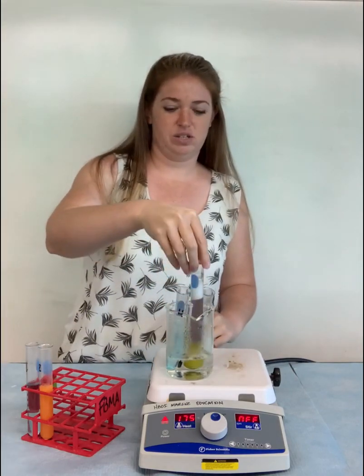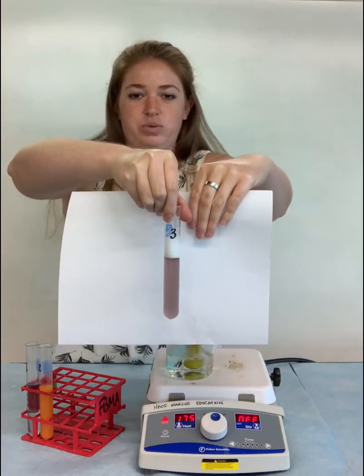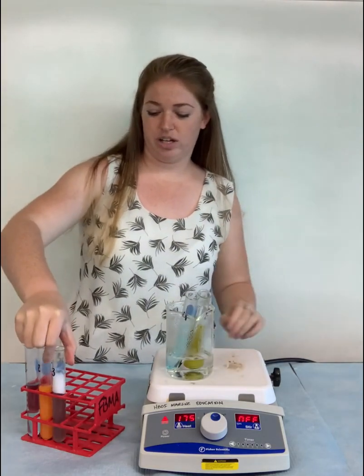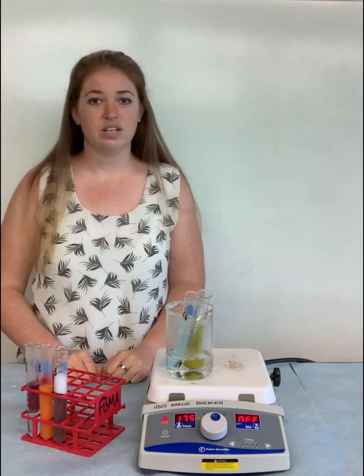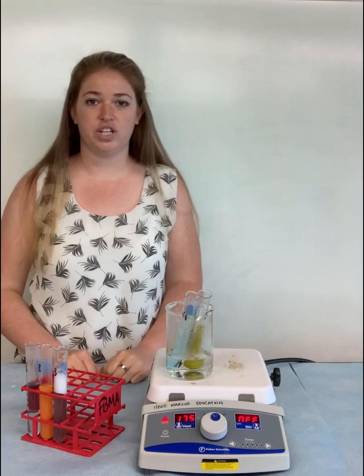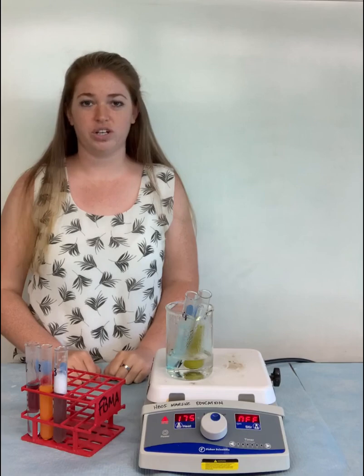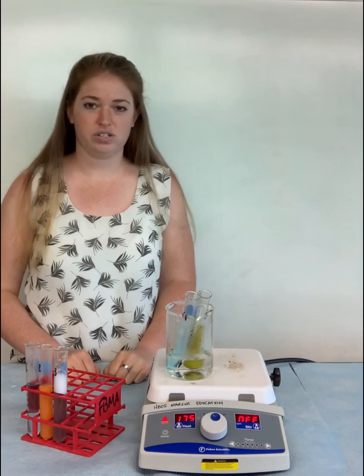Let's take a look at test tube number 3. Now we did see a color change with test tube number 3. We have almost a purple or grayish color here. However, that's not one of the colors that gives us a positive result for the monosaccharide test. Again, what we're looking for is a color change to yellow-green, which would be a low concentration of simple sugars, or orange or red, which would be a high concentration of simple sugars. We're not seeing that here, so that is a negative result for our monosaccharides.